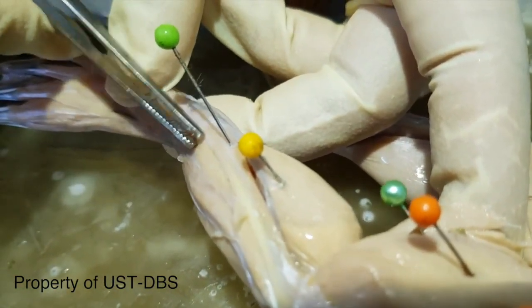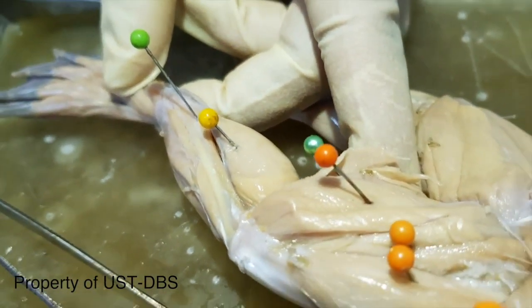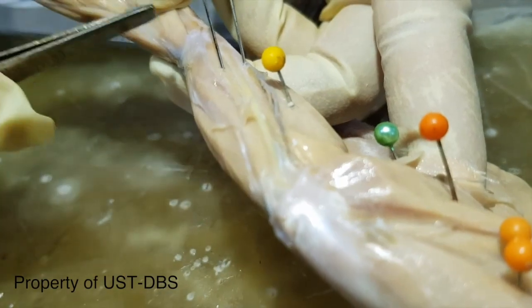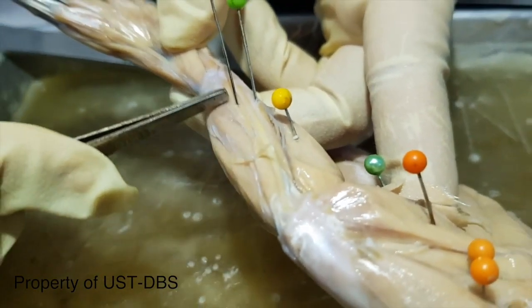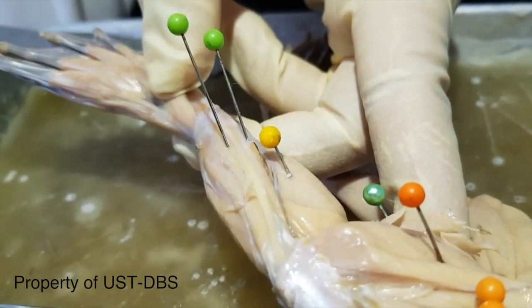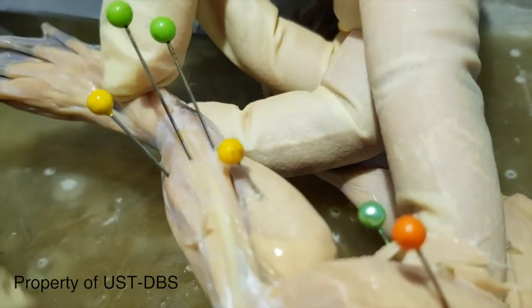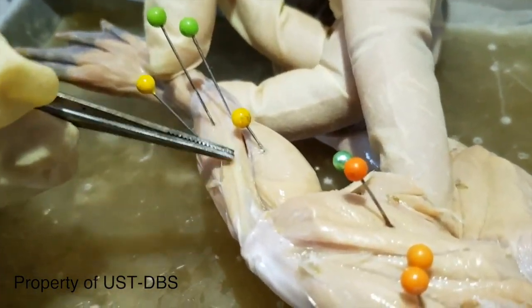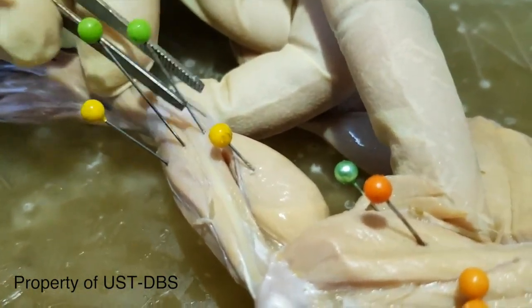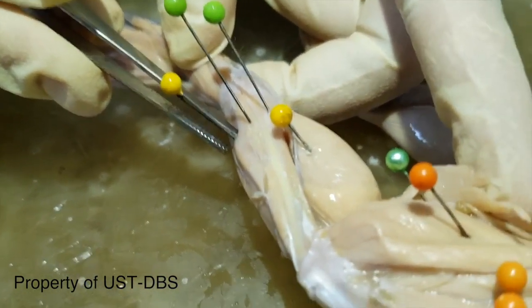This small muscle here that's triangular in shape is the extensor cruris. And this muscle, on the side of the extensor cruris, is the tibialis anterior. Tibialis anterior. So the basis is the tibia bone. In between is the tibialis posterior. This one, tibia bone. This is the extensor cruris, and then this is the tibialis anterior. Okay?